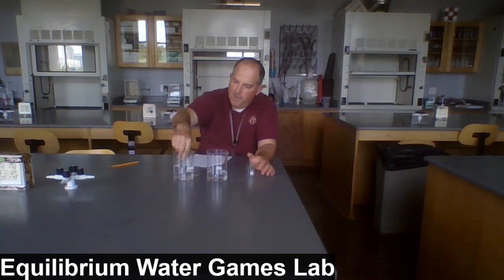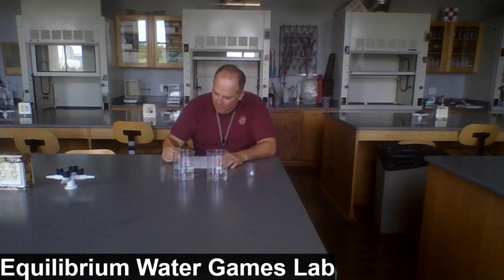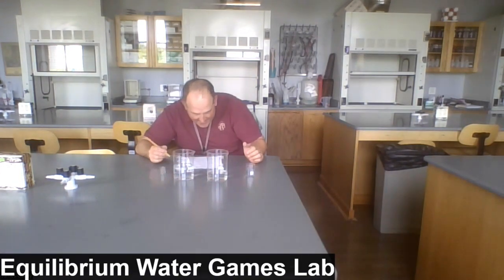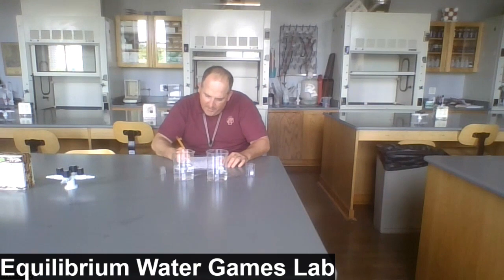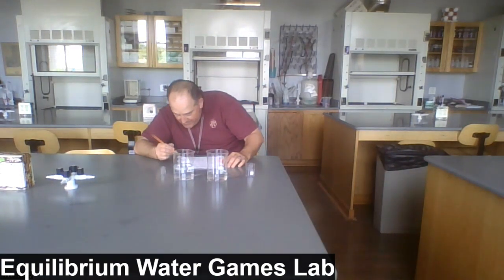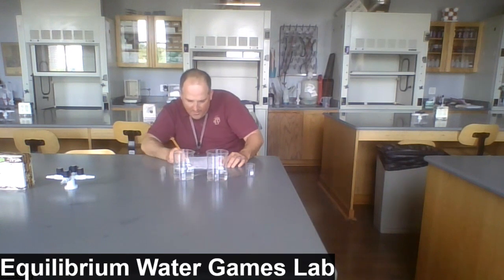Trying to minimize the spilling, but also realizing that that's part of lab is spilling. Okay, after transfer cycle 2, we've got 180 milliliters in beaker A, and I'd say 330 in beaker B.